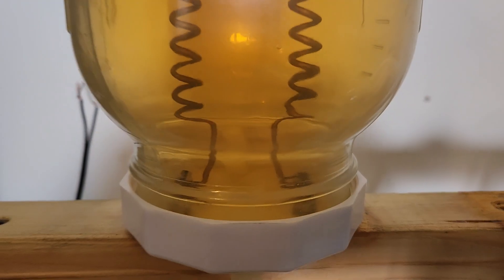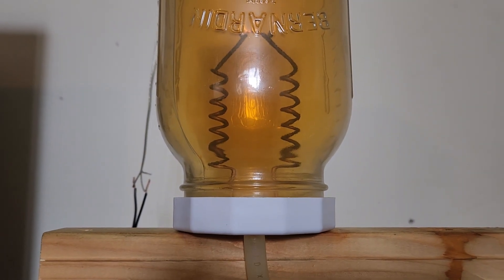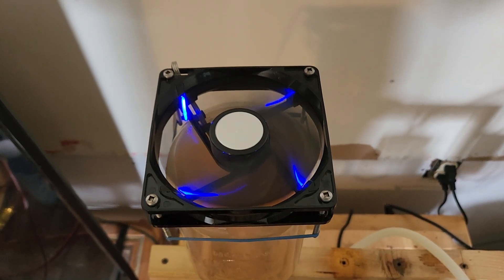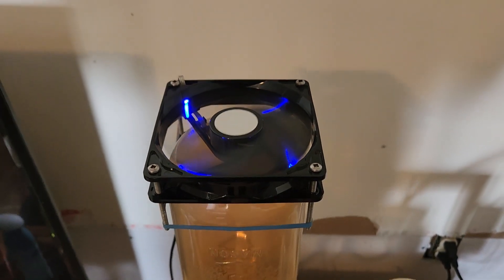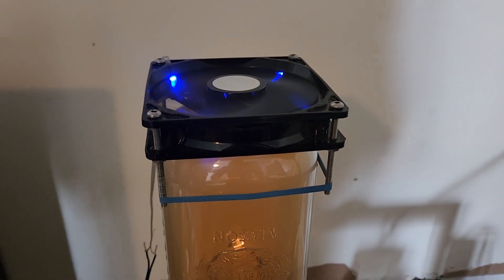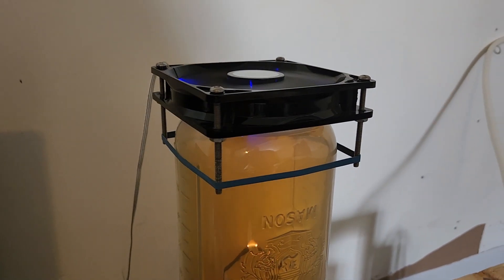This is the new cooling system consisting of a 12-volt computer fan mounted with the help of four nuts and bolts and a rubber band. A simple yet effective, easily removable cooling solution is achieved, again adding to the overall safety of the generator.